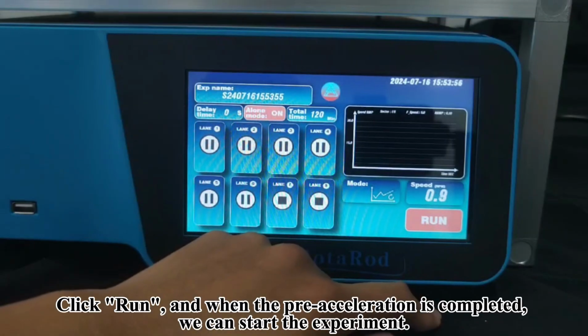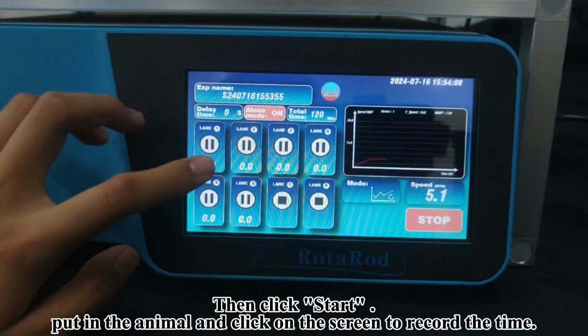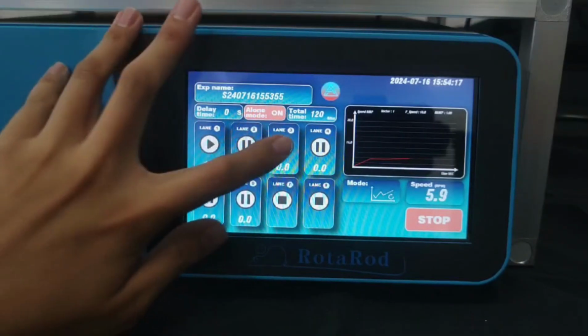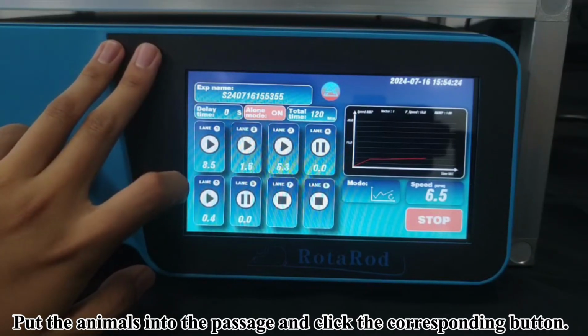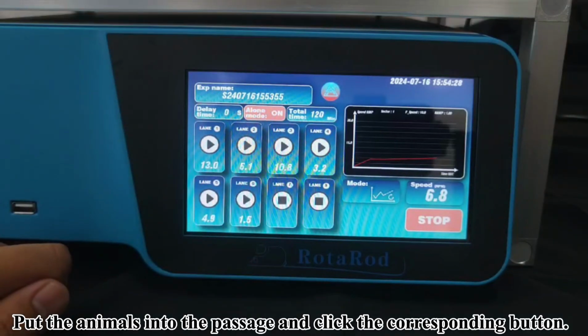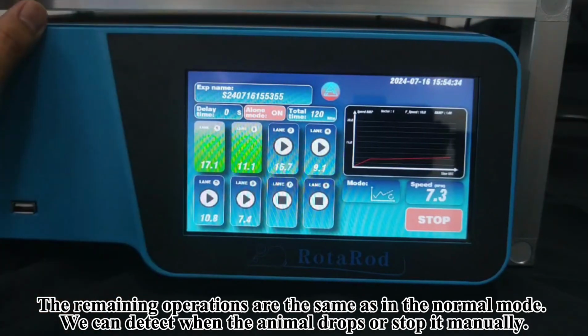Click Run, and when the pre-acceleration is completed, we can start the experiment. Then click Start, put in the animal, and click on the screen to record the time. Put the animals into the passage and click the corresponding button. The remaining operations are the same as in the normal mode.